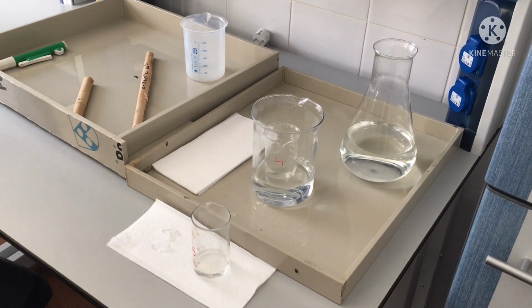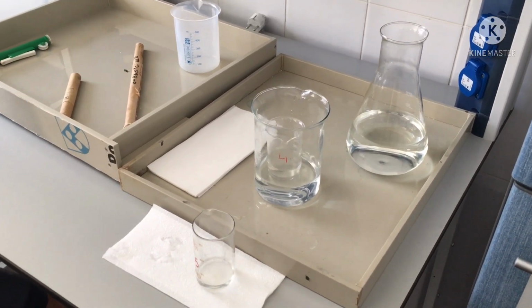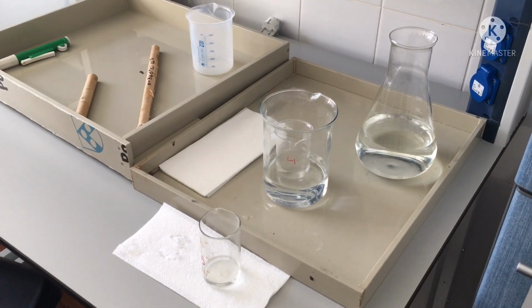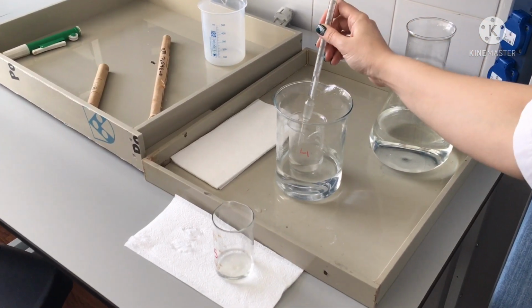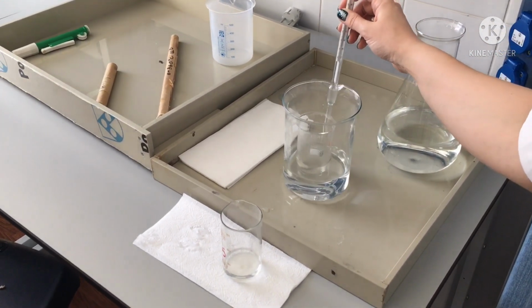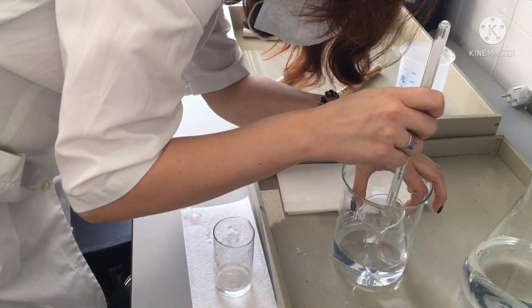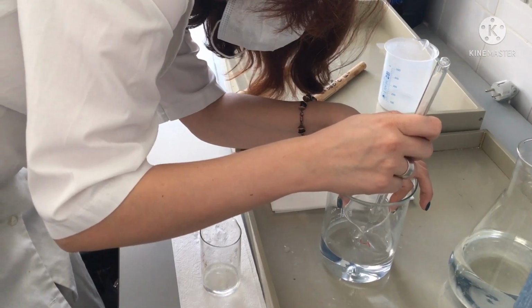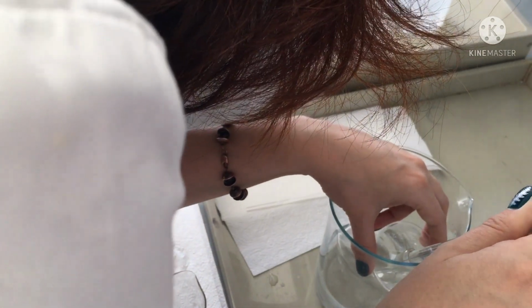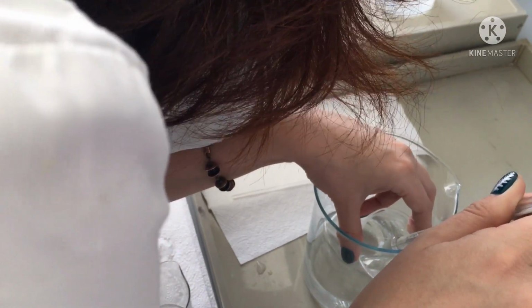This will be for hot temperature. We will wait for the mixture to reach a temperature of about 40 degrees Celsius. Now let's measure. We need about 40 degrees Celsius. 37. Now we will wait for the temperature to stop rising and we'll write down this value. It will be hot enough for our purpose.